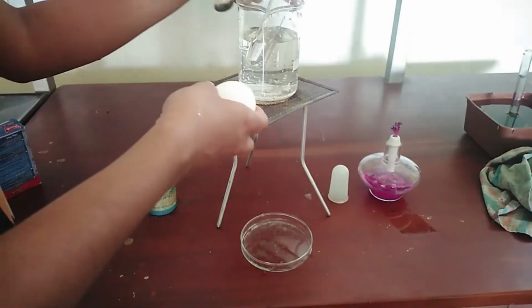Today, we are going to see a special practical that can be seen in the grade 10 and grade 7 syllabus. And also, this practical is very important for the O-level students. The practical is to identify the proteins. There's a special name for this practical, that is the Biuret test. From here, we will see what are the steps to do the Biuret test.